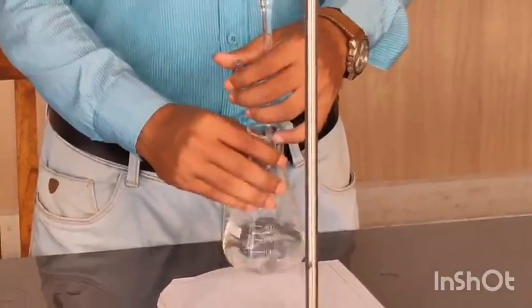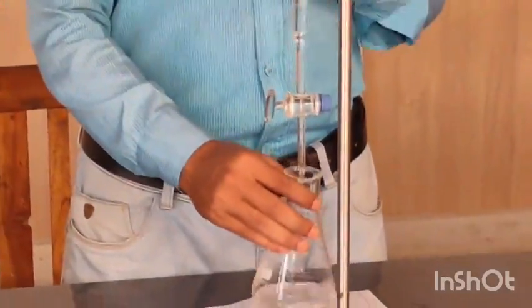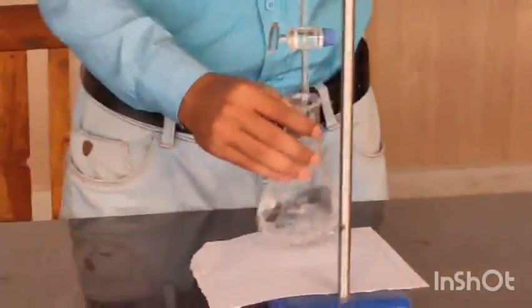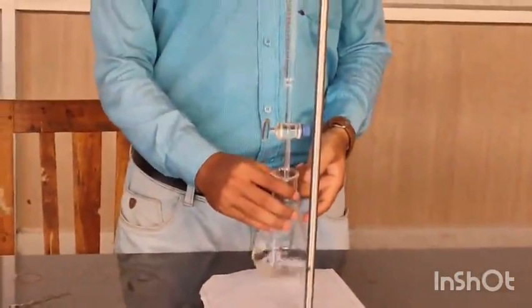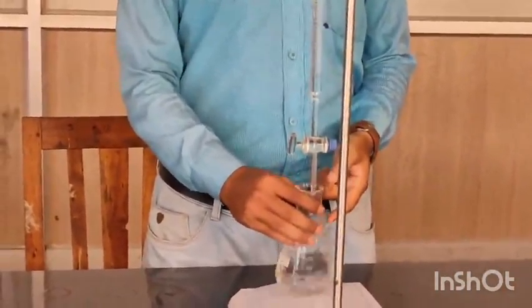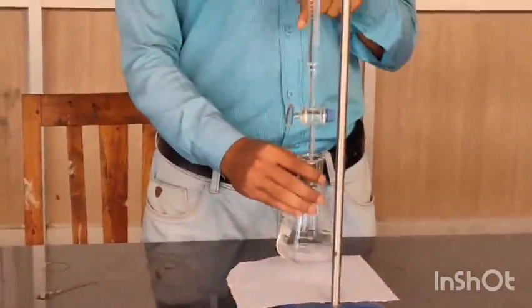Always remember that whenever you are titrating using a burette, your concentration should be inside the solution, not on the burette reading. Always remember that, because if you concentrate on the burette reading, suddenly you will see that your color has already appeared and you have added some extra amount, and it will make your calculation error. So be careful with that. Your observation should always be in the solution.